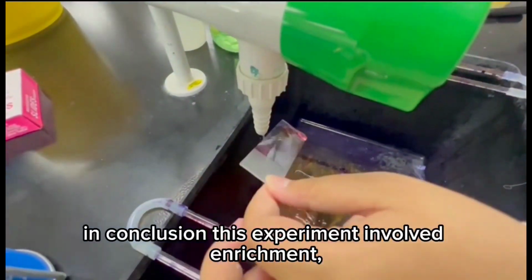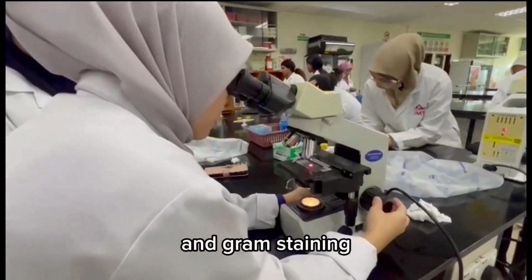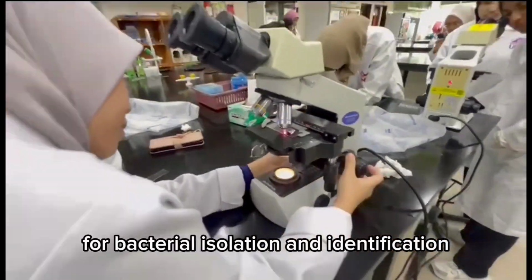In conclusion, this experiment involved enrichment, streaking, incubation, and gram staining for bacterial isolation and identification.